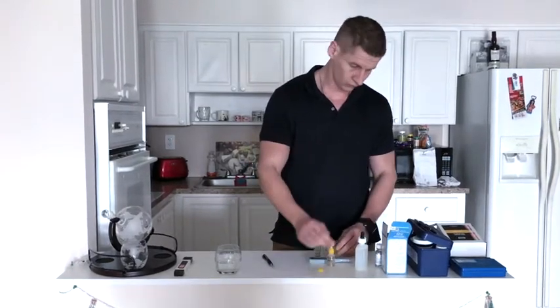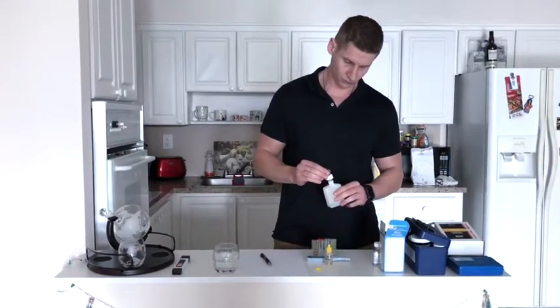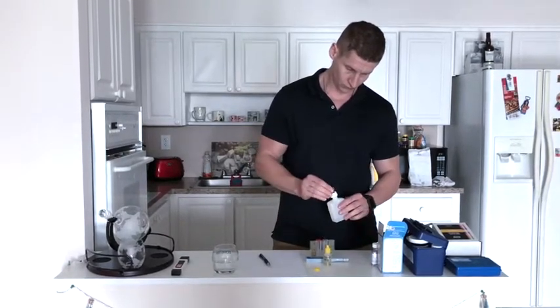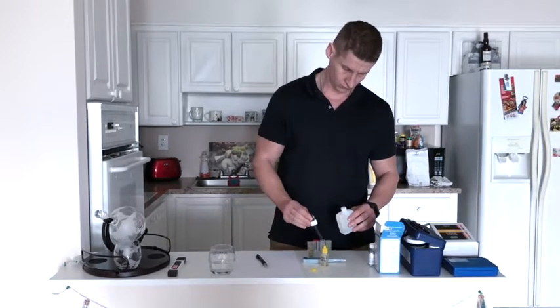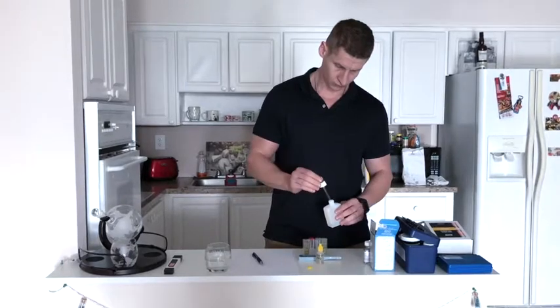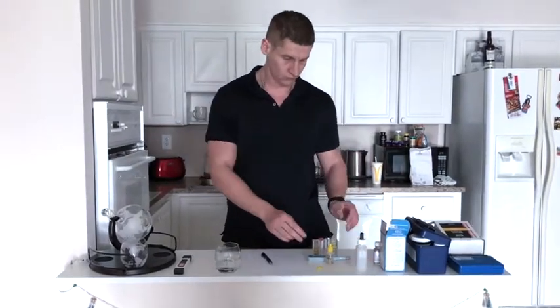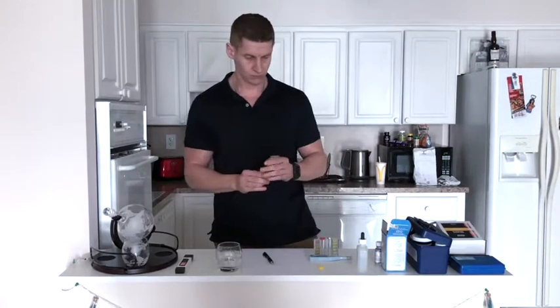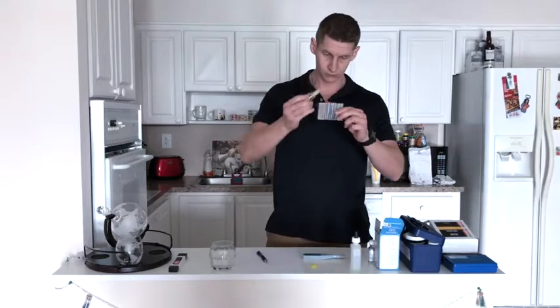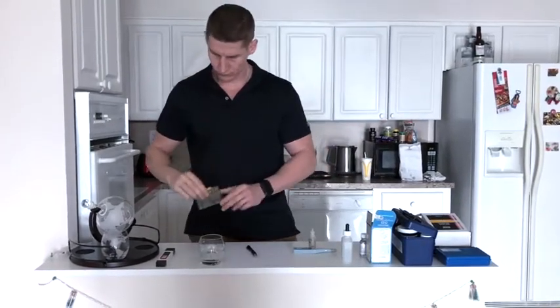This elevated TDS indicates the following problems. 1. The concentration of the dissolved ions may cause the water to be corrosive, salty, or even give it a brackish taste, resulting in scale formation and decreasing the efficiency of hot water heaters. And high TDS water can contain elevated levels of ions that are above the primary or secondary water standards, such as an elevated level of nitrate, arsenic, ammonia, nitrites, etc. They will be searched in the next steps.